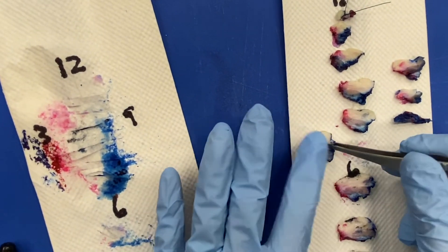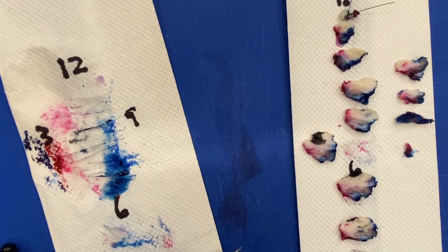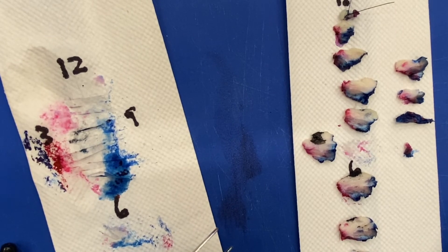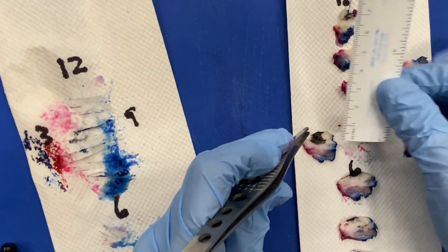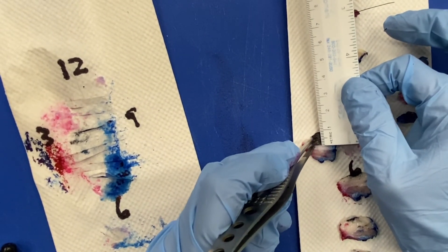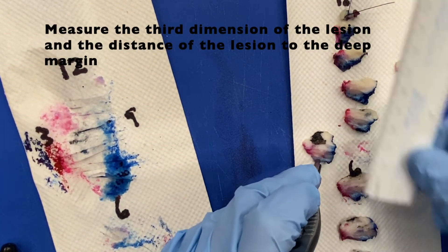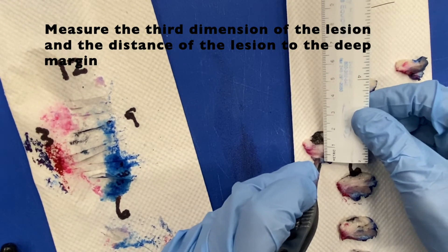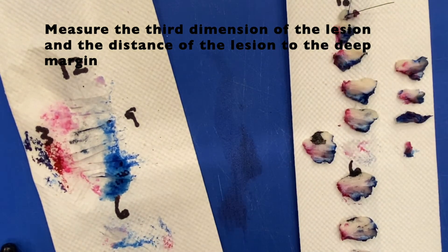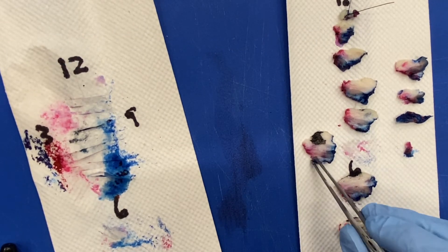The specimen is serially sectioned 12 to 6 o'clock to demonstrate a tan-white to tan-pink cut surface. The lesion extends 0.9 centimeters from the skin surface and is located 1.1 centimeters from the deep surface of the specimen.